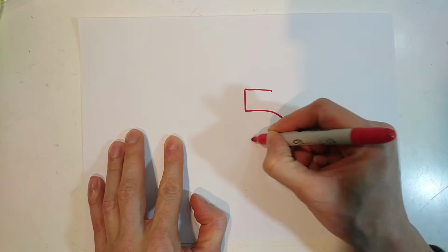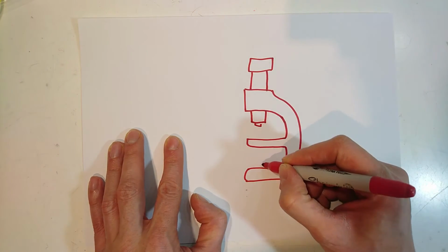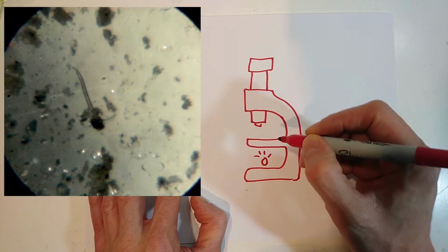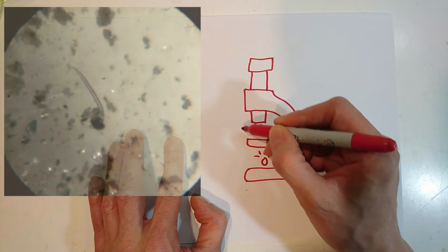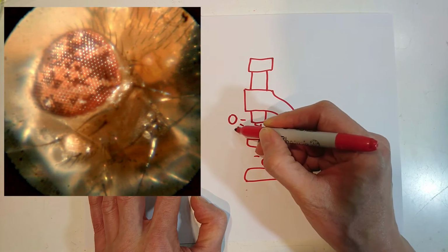The last crucial component for my microscope is light. I will give my microscope the traditional illumination from behind, which is useful to see mostly transparent objects, and also light from above, which is useful to see opaque things.